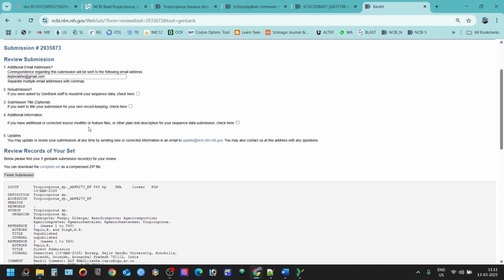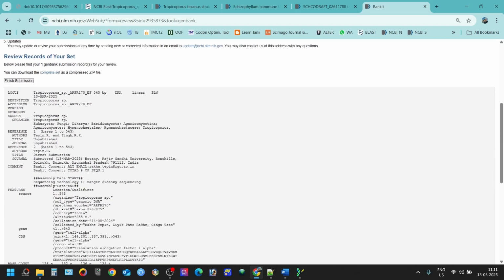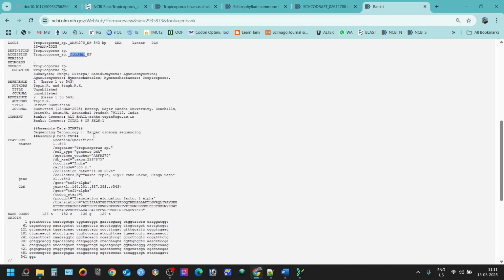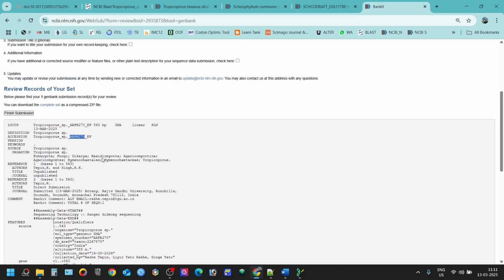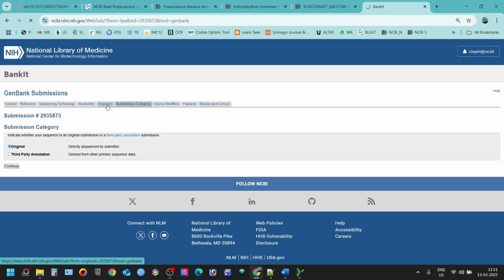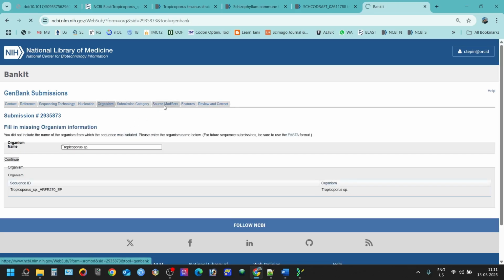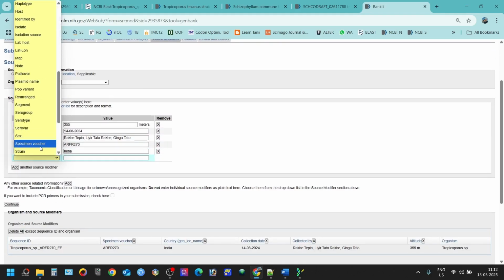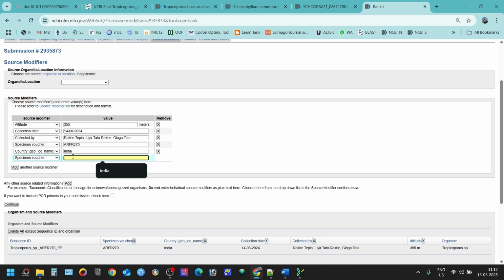and you can put all the information that you need, and you can check here if all the things are correct. For example, this is a Tropicoporus species with this accession number. And also choose, for example, submission category, original organism. I'm just checking if I mentioned the, okay, I have not mentioned the specimen voucher. You also have to mention that. Now we are done. Continue.